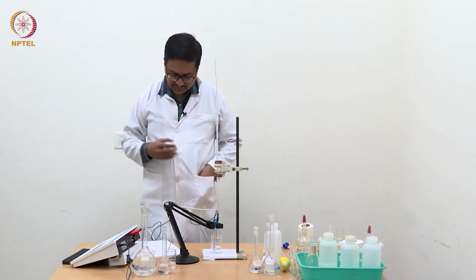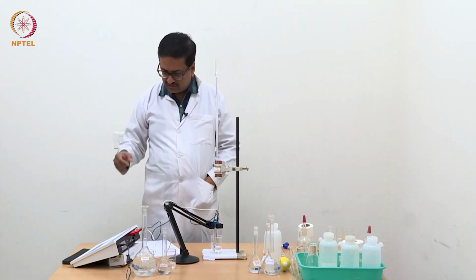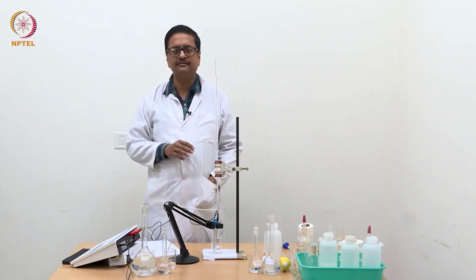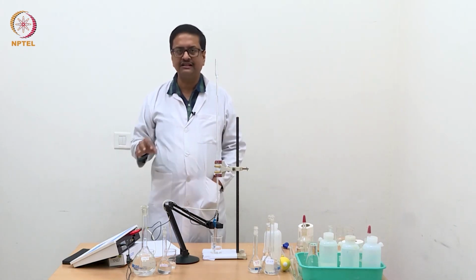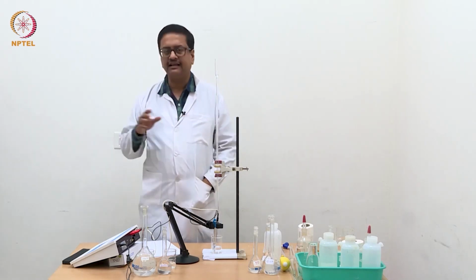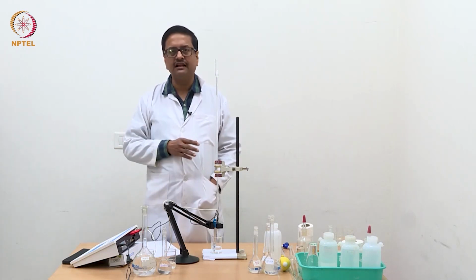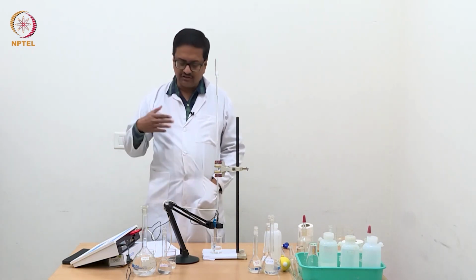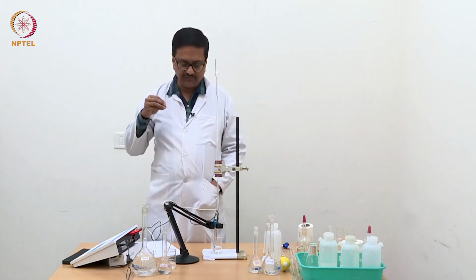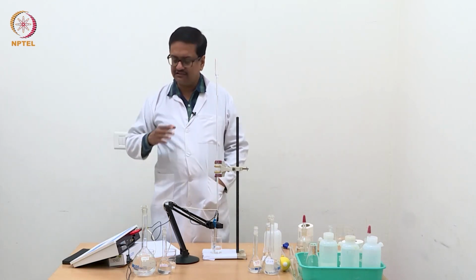So you can see that every time I am adding 0.04 ml, now we have reached 0.28 ml. Initially the conductance decreased because when we added NaOH, it consumed the dissociated H+, and now the conductance is increasing because acetic acid is further dissociating. So this was not observed during the titration with HCl, because HCl is always fully dissociated. As soon as we added NaOH, it consumed some H+ ions and the conductance got reduced, and it stayed at that reduced value.